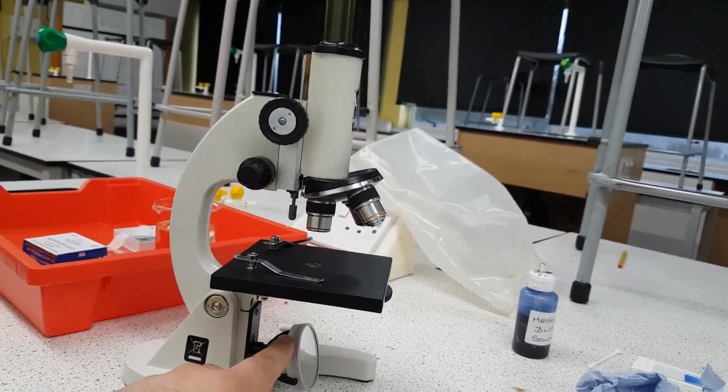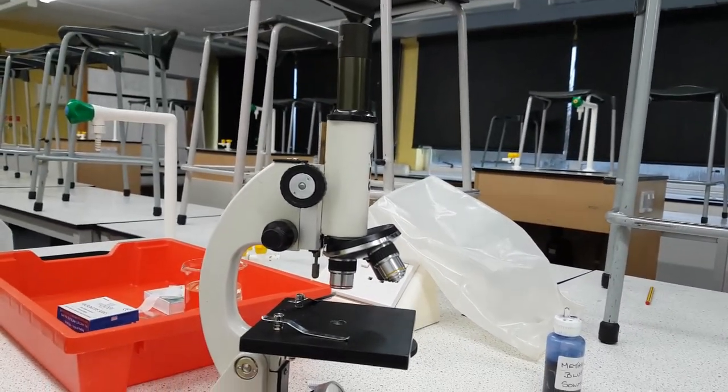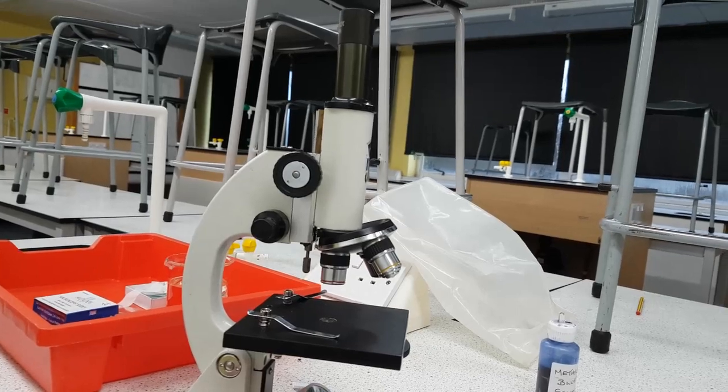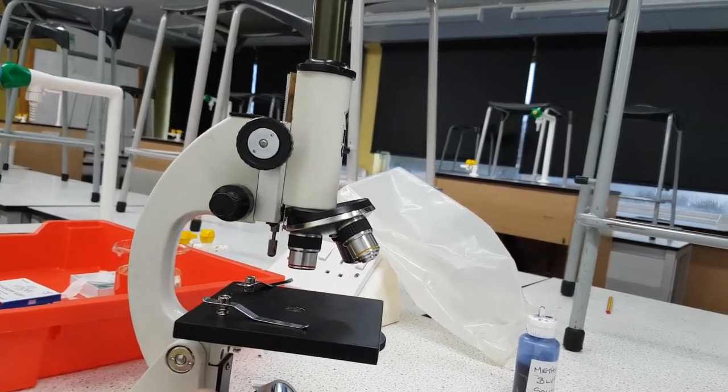And then slowly tilt it towards the eyepiece until the eyepiece becomes really bright. That's what I like to do, so that's how you set it up.